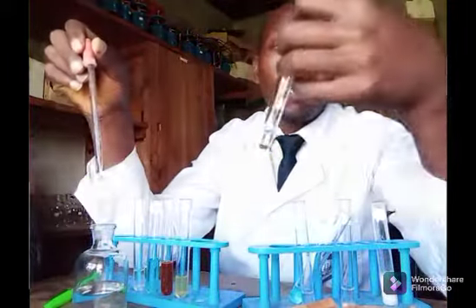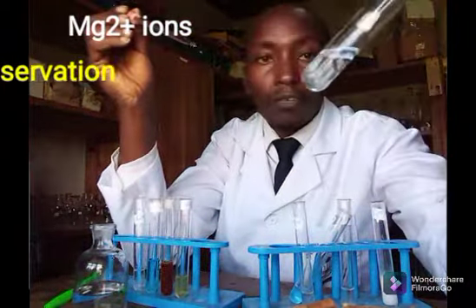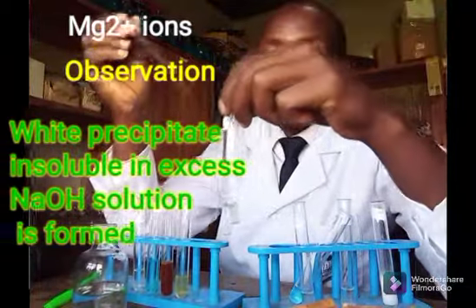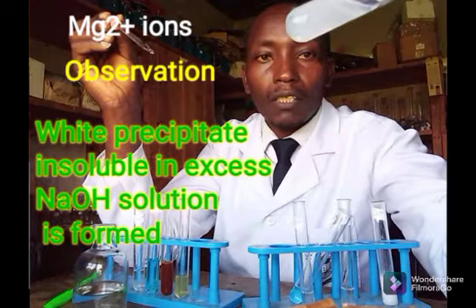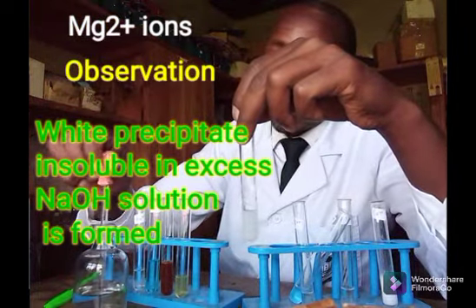Then I have another one with magnesium ions. So I'm adding a few drops. Yes, a faint precipitate there. Now the precipitate is very clear. A white precipitate has been formed.